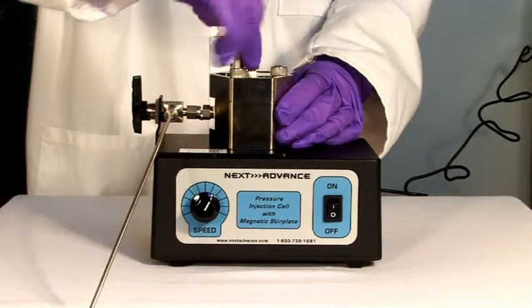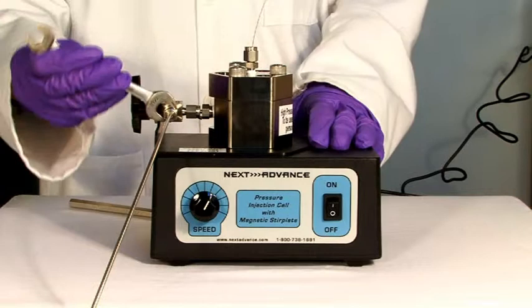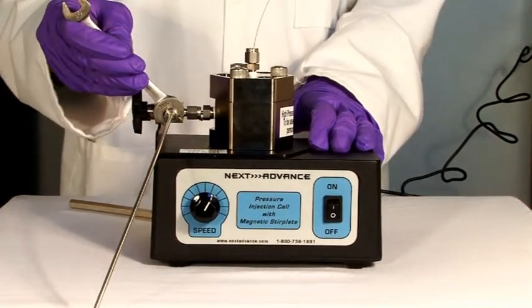This is important. Before applying pressure to the cell, make sure that the bolts are securely fastened and all connections are properly tightened. Wear protective eyewear.